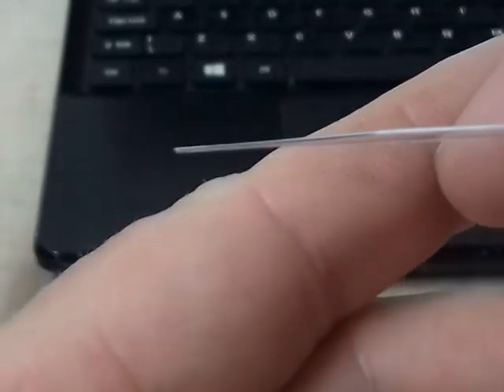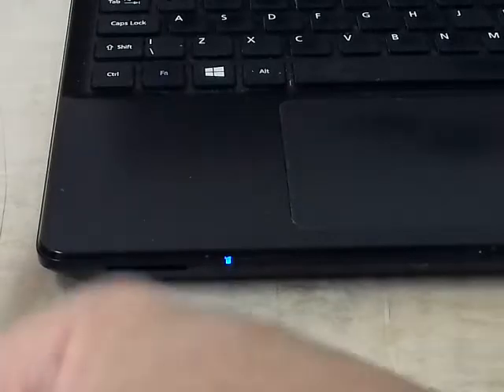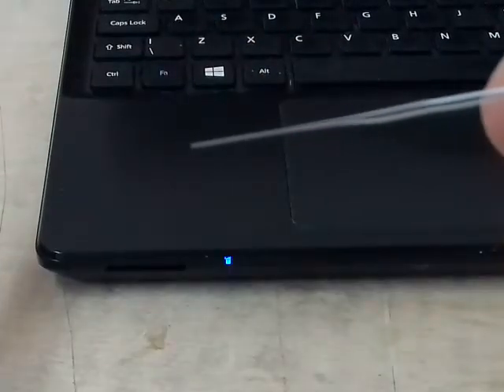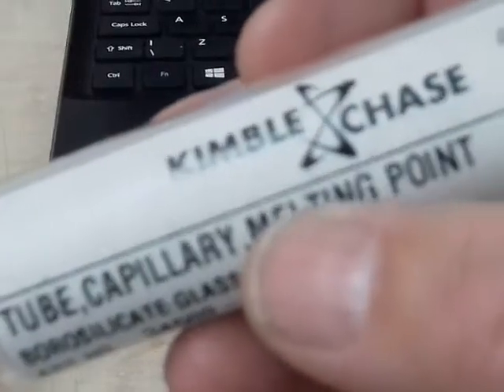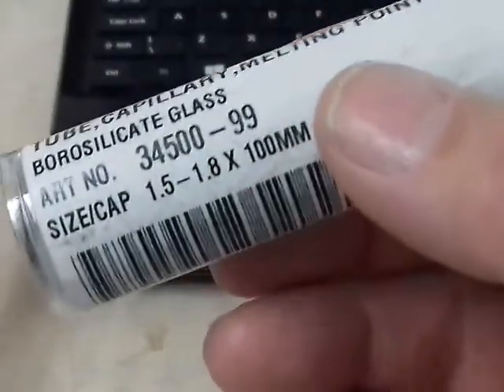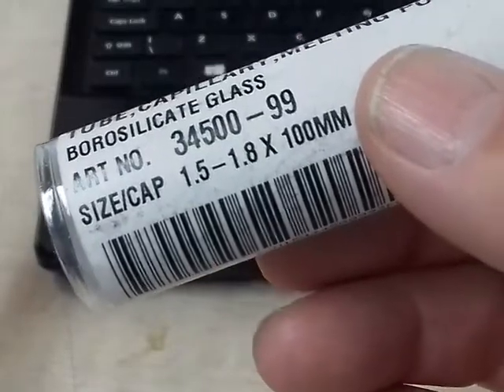Nice and fine. If I put it back onto a dark background, you'll be able to see it better there. It's difficult to see under camera actually. Go for another one. That's a bit finer. So with a bit of practice, you can make viable pipettes. The ones I've got here from Kimble Chase, capillary tubes, melting point, and they do vary in thickness, 1.5 to 1.8 this batch.